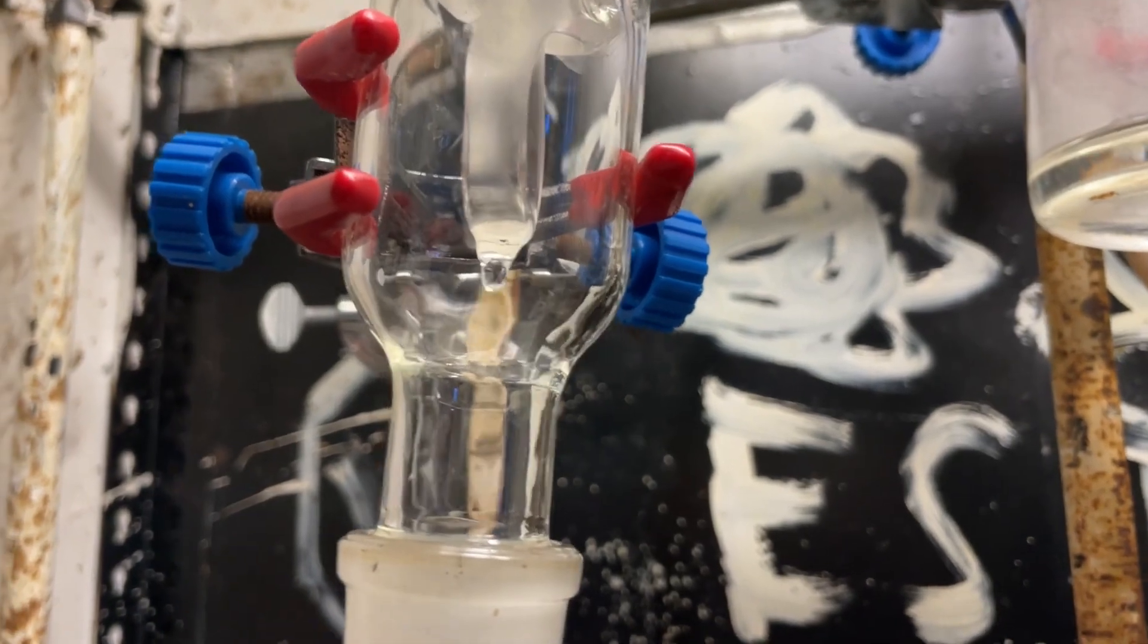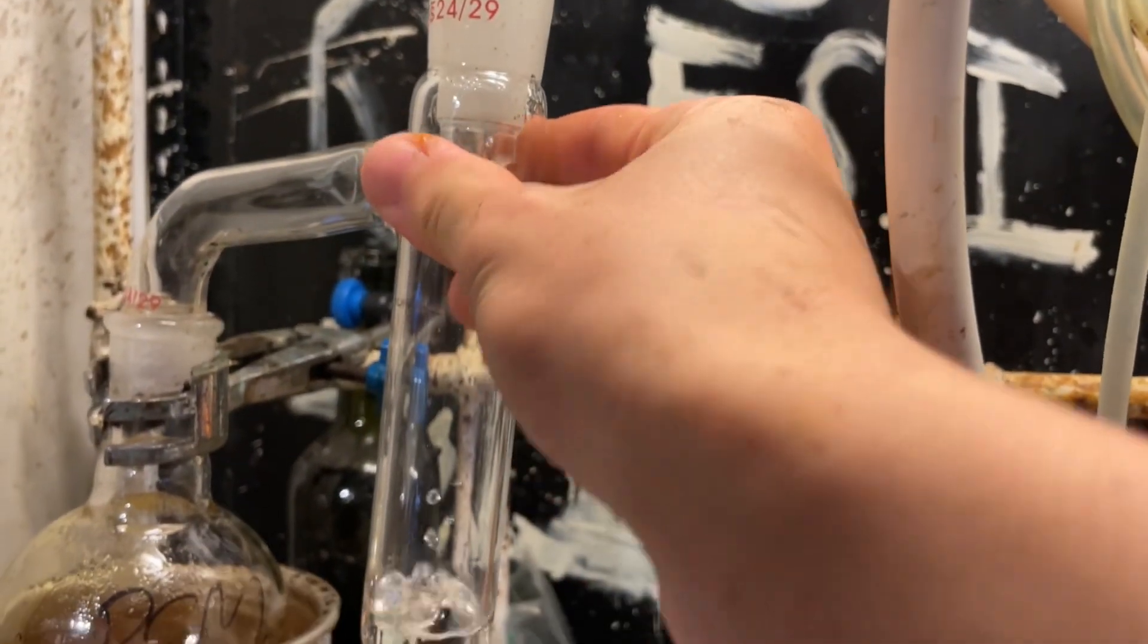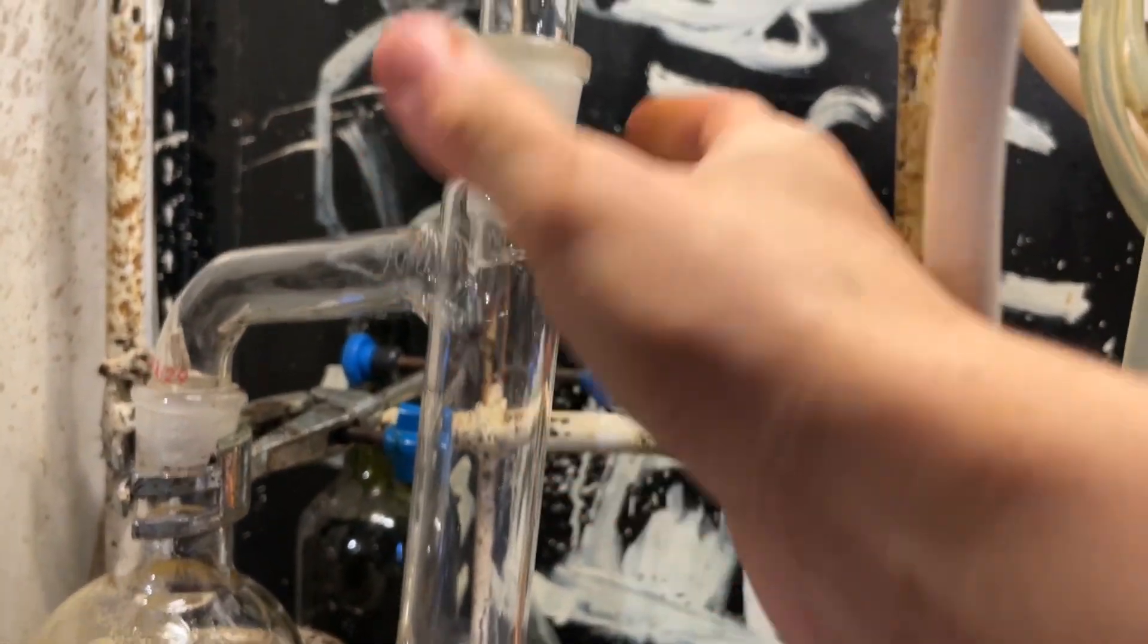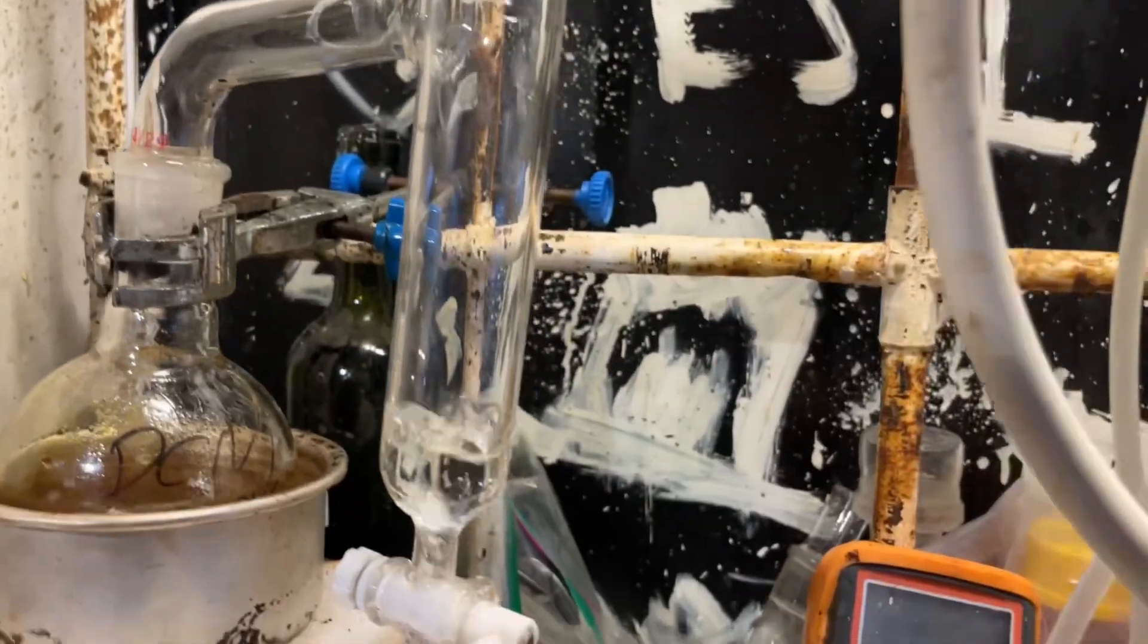So, here you can see my dichloromethane is actually boiling from the radiant heat of my hot plate. Insane, I know. But it's a very good hot plate I built on myself. So, after most of dichloromethane was off, I left a tiny bit still distilling over, because that contains a lot more benzaldehyde. And I pulled a vacuum on the set to vacuum distill over the benzaldehyde. Now, yes, this is not a conventional vacuum distillation setup, but it works. Dean-Stark apparatuses are underrated. They're literally distillations. They work great for distillation.